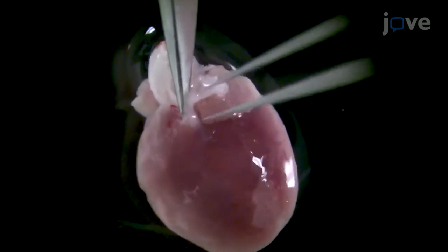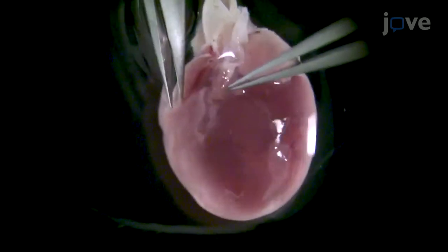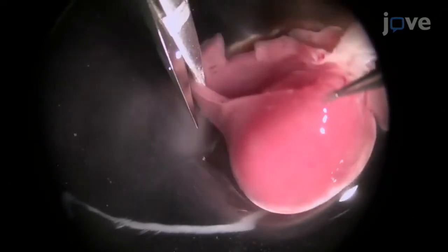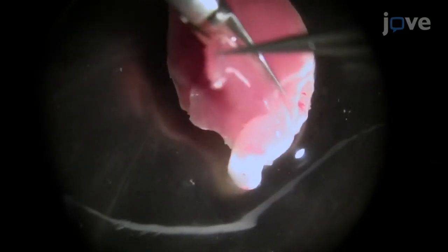Use scissors to cut through the pulmonary artery down to the right ventricular chamber and cut along the septum until the apex is reached. Continue cutting from the apex up the posterior side of the heart along the septum until the junction of the pulmonary artery and the right ventricular chamber is reached.